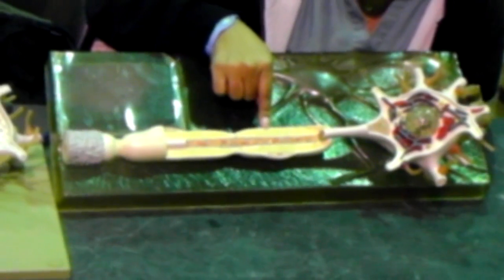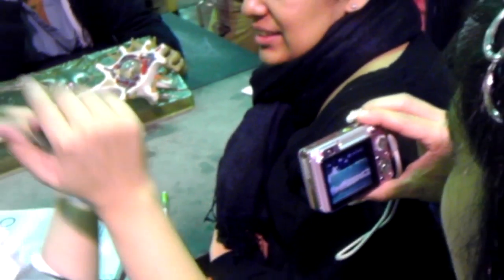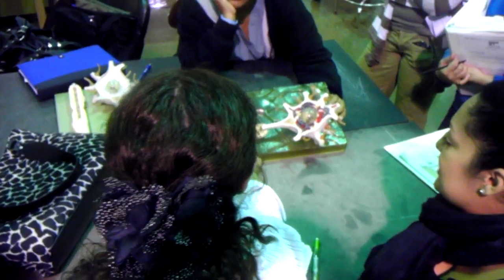Myelin sheath. The nucleus of which cell is over there? Can you tell me? Very good, the Schwann cell. These are the organelles that you have inside the axon, but this is the nucleus of the Schwann cell. You remember that the Schwann cell is a kind of neuroglia, responsible for what? Myelination of the myelin sheath in PNS or CNS? Be careful. In CNS, who is responsible? Oligodendrocyte, right? So this is the PNS and this is the Schwann cell.